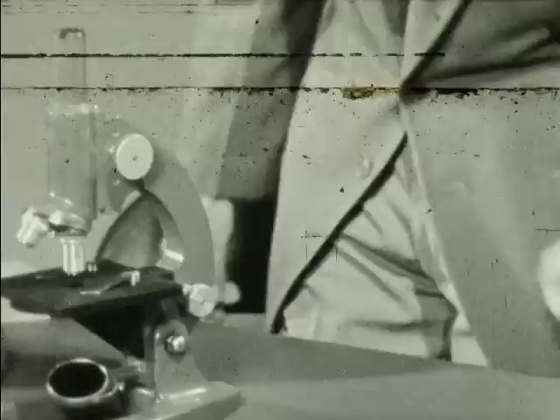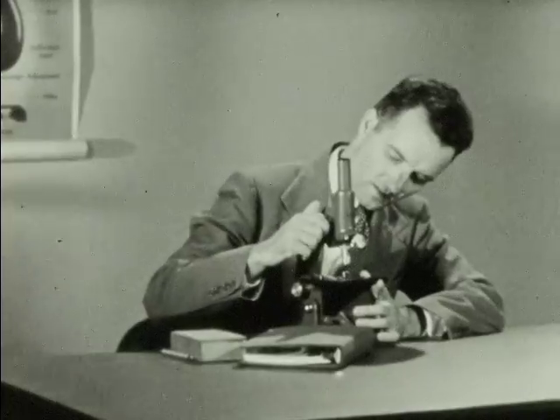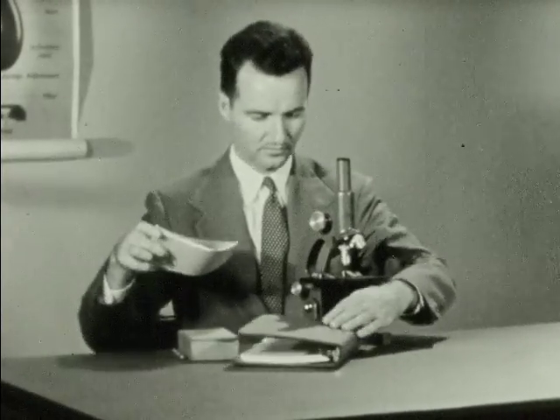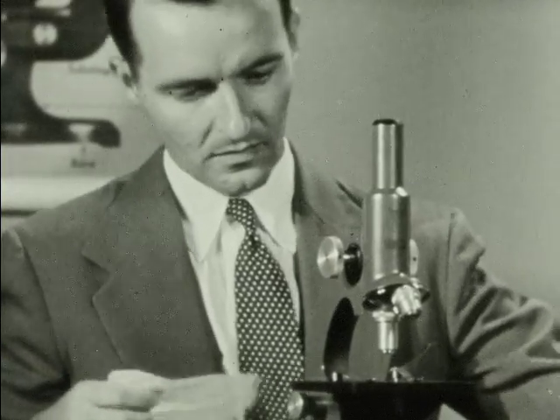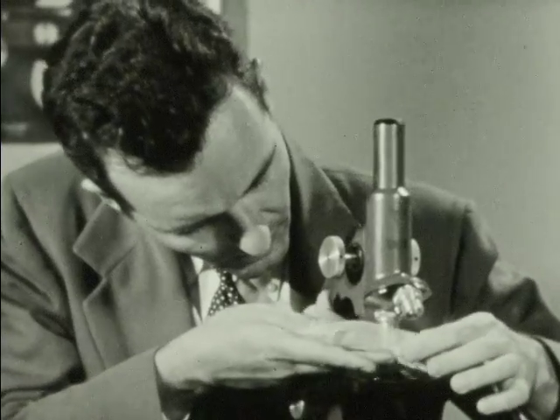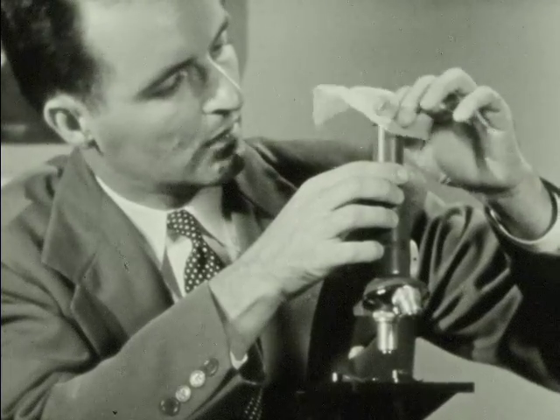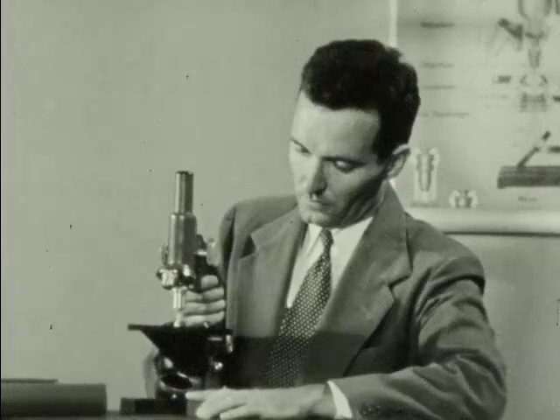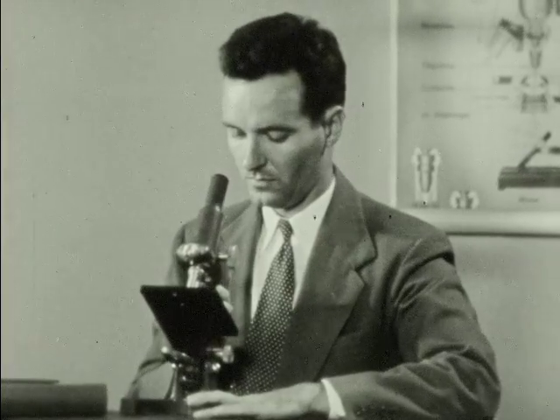So you're ready to begin using the microscope. In using the microscope, the first step of preparation is in making certain that all lens surfaces are clean and free of dust and lint. If the instrument hasn't been used for a time, the lenses will probably need cleaning. Use lens tissue, never your handkerchief, and gently clean the objectives and the eyepiece. The glass from which the lenses are made is soft and easily scratched, so be very careful. Then, unless you are instructed otherwise, tilt the microscope body until it is in a comfortable position for you to use.